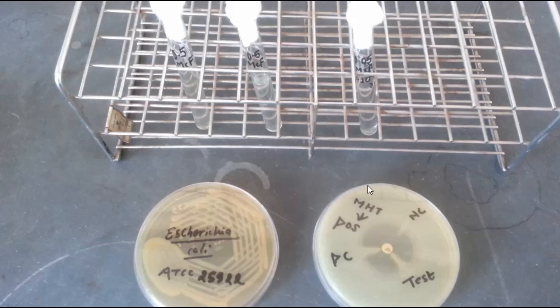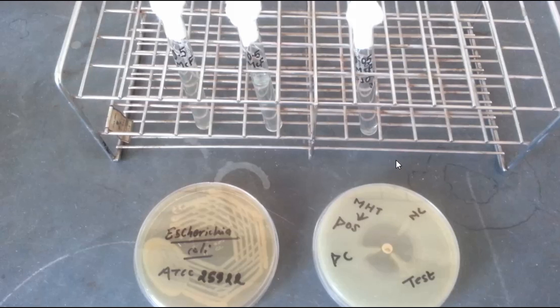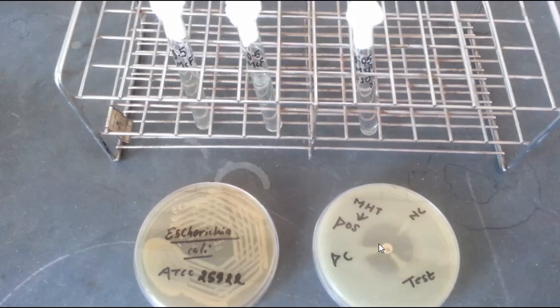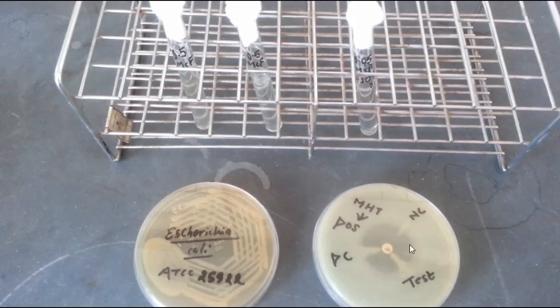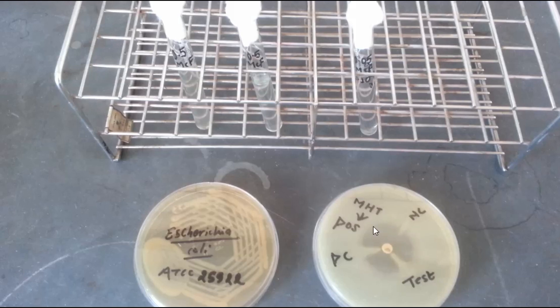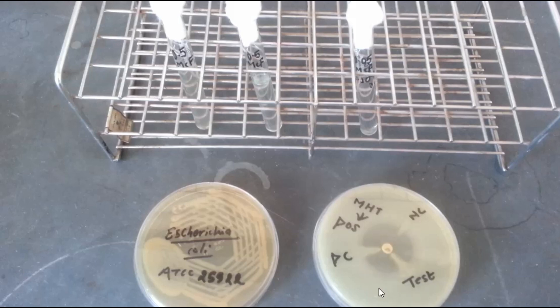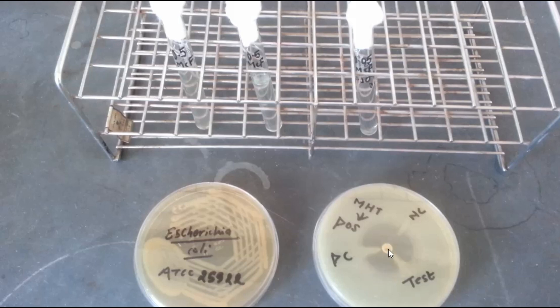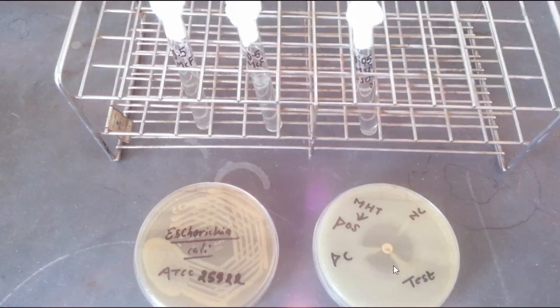From this 1 to 10 dilution of E. coli ATCC 25922, the suspension was streaked onto a Mueller-Hinton agar plate and allowed to dry for 3-5 minutes. A 10 microgram Meropenem disc was then placed in the center of the test area.